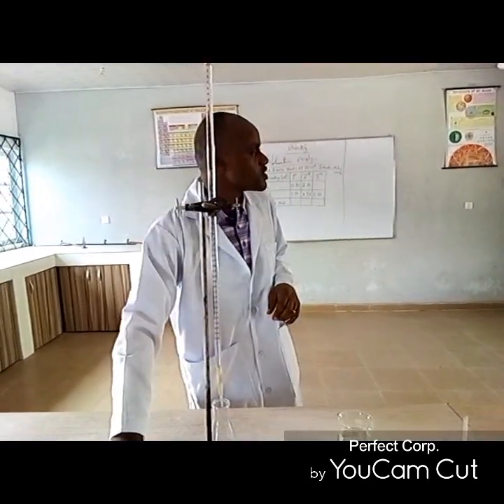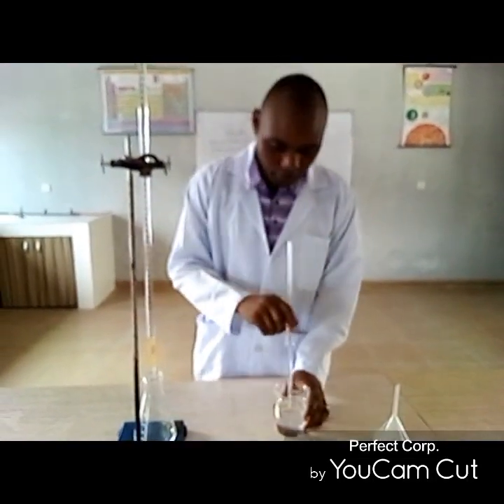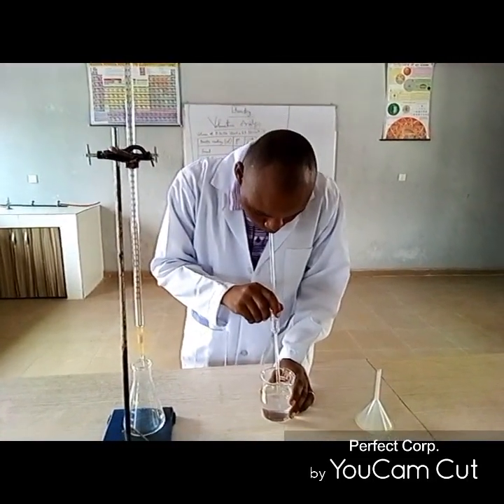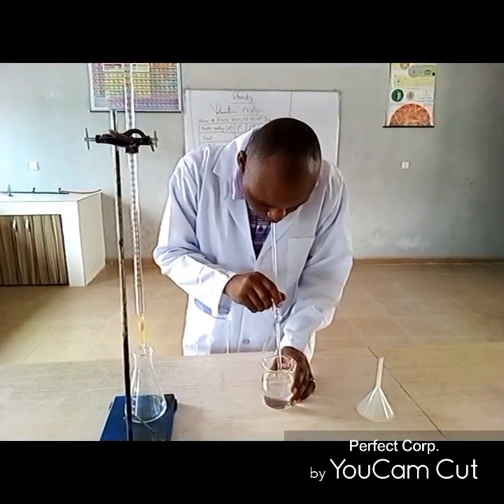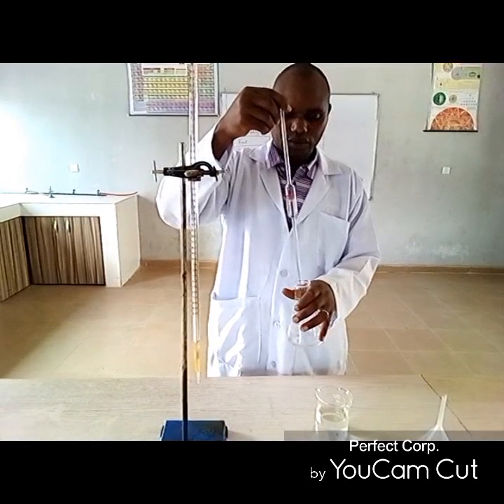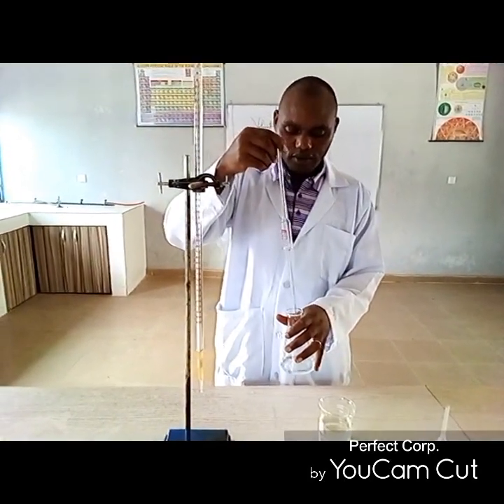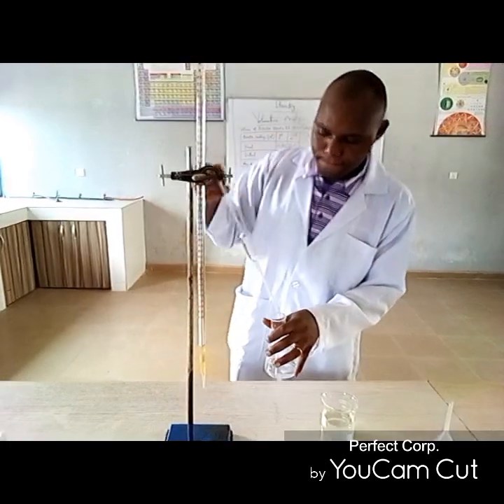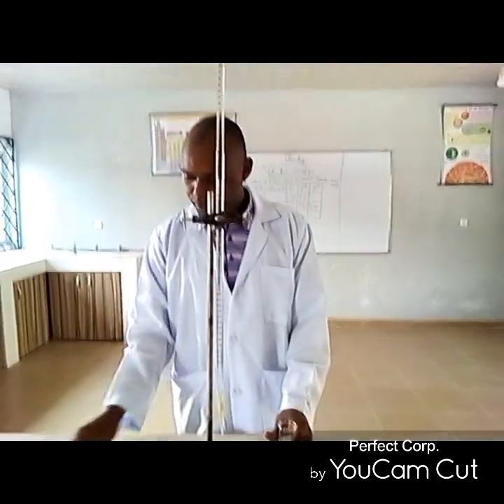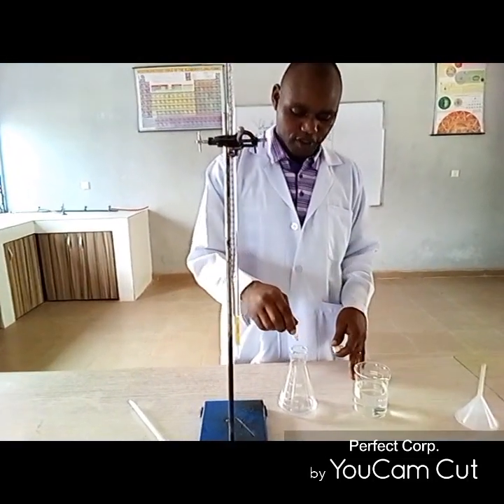So please take note of that. Now let's sip the base. Let's sip the base. We are going to apply 2 drops of the indicator.